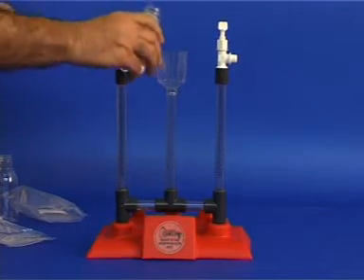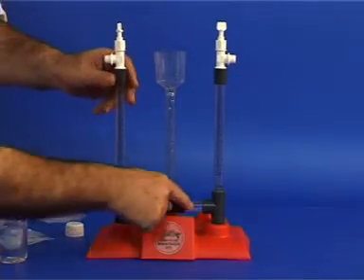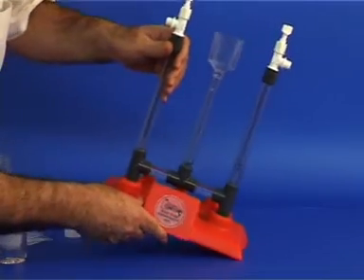Now, pour a small amount of the solution into the middle tubing. Tilt the apparatus in order to release the trapped air.